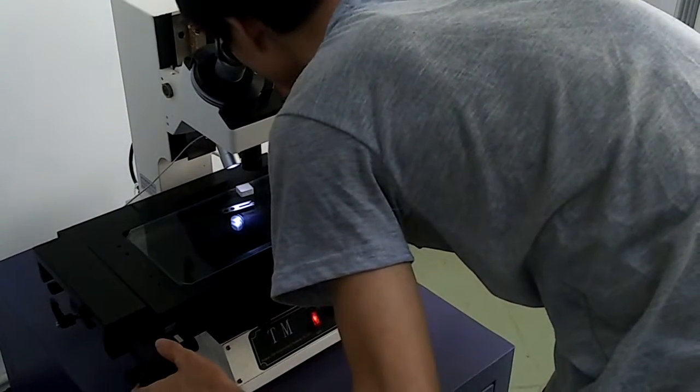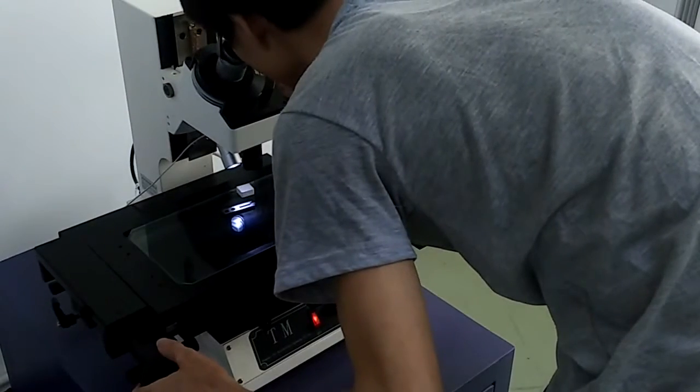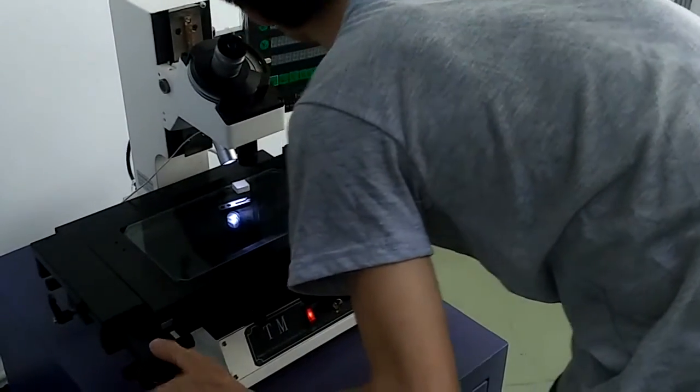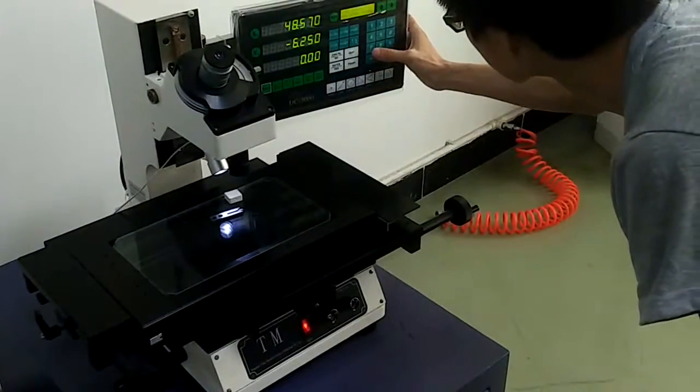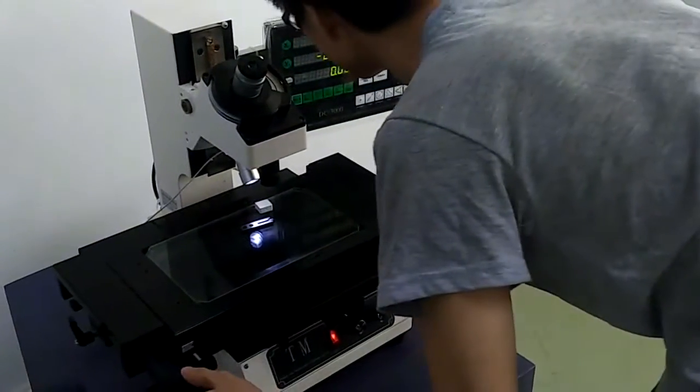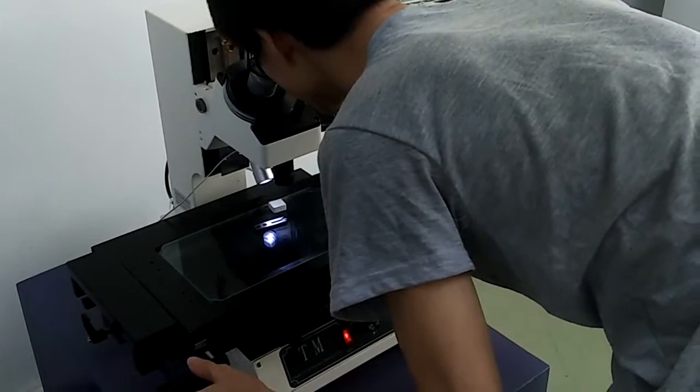After we capture the point through the eyepiece, just confirm it with the panel DC3000. And we can also see it according to the data on this DC3000 panel.